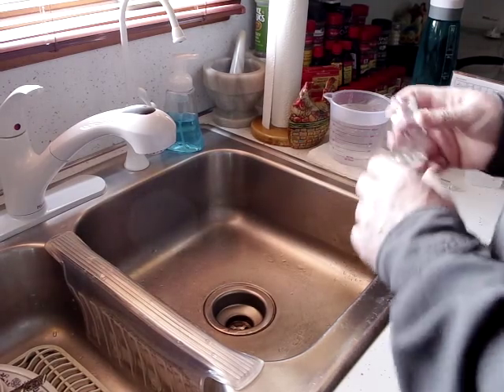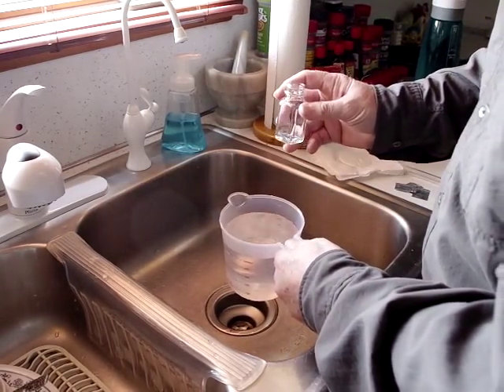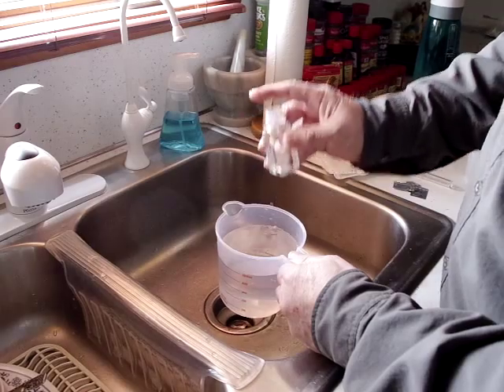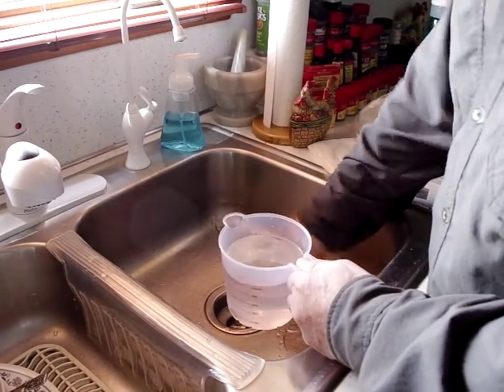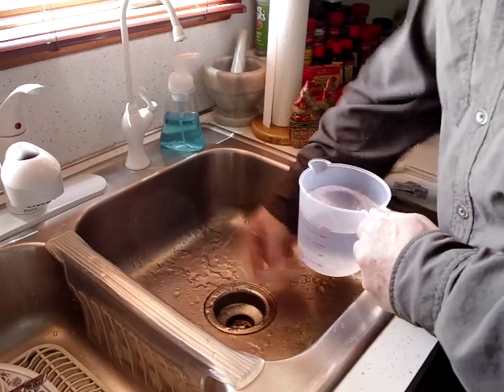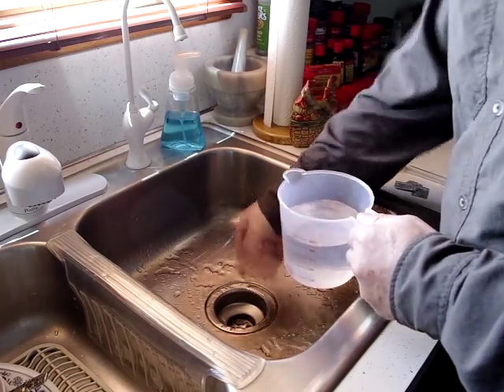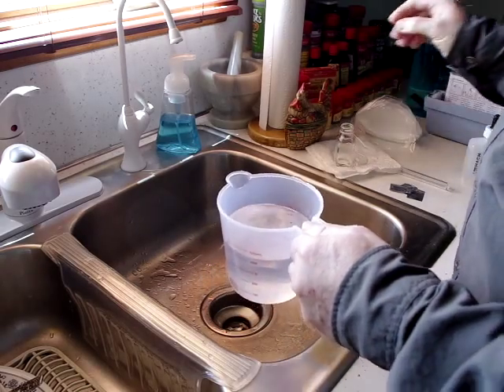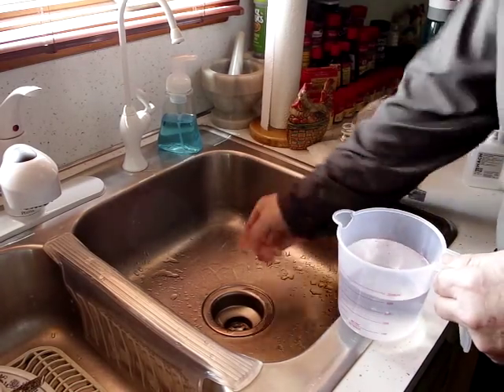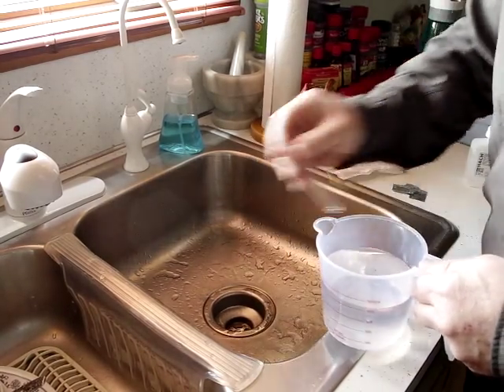What I don't like when I see online — and I do have a little bit of experience with this on jobs — is people don't clean the bottles. You really need to clean the bottles, clean the shakers, clean everything. Get it full, put your finger halfway over, and just shake it up. Do this three different times, so there's no residue left. What you're doing is trying to get out any residue from previous tests.